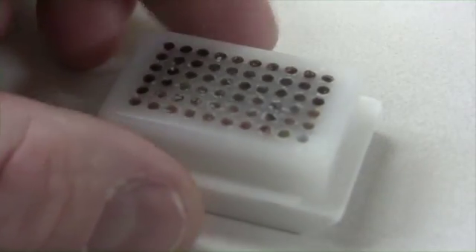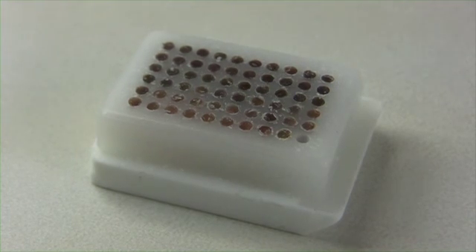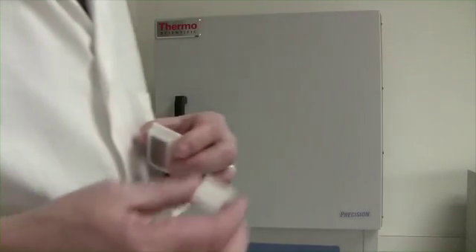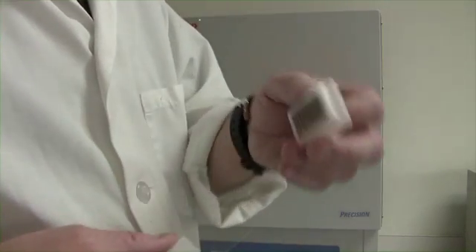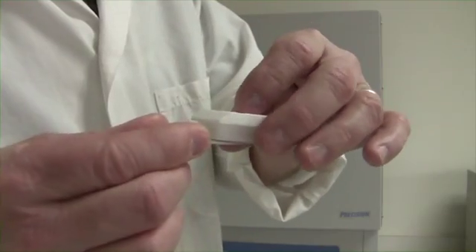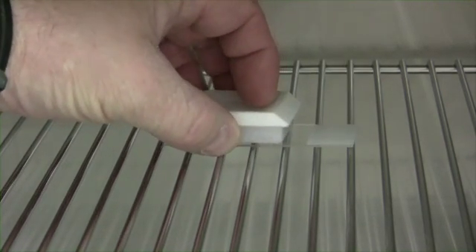Now we can begin to set the punches. Warm an oven to around 43 degrees Celsius. Place the array block on a glass slide face down. It doesn't matter if it's a charged or non-charged glass slide. Some people leave the array block in the oven overnight to soften and set the paraffin to the tissue cores, but we have found that two to four hours works just as well. You may want to test this for yourself because some tissues might need more setting time.